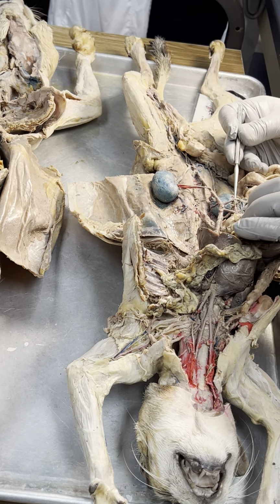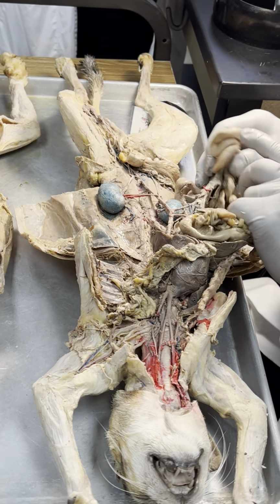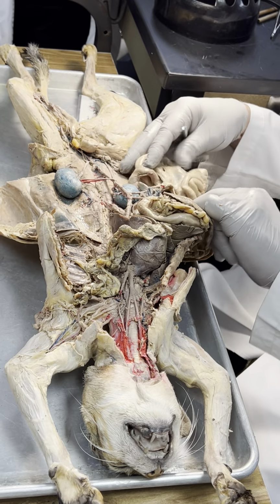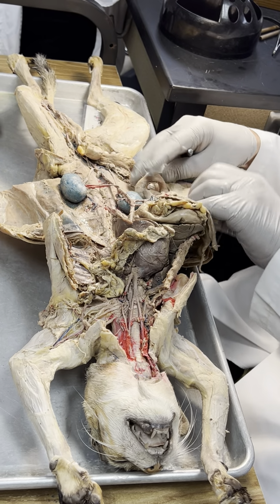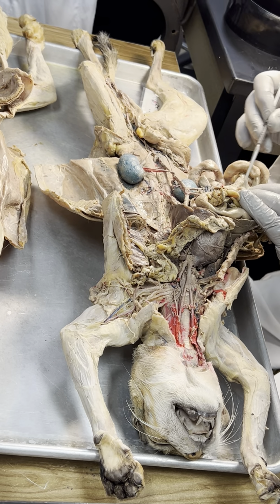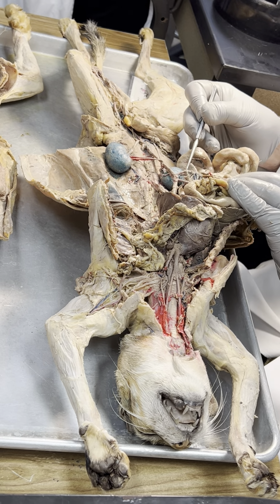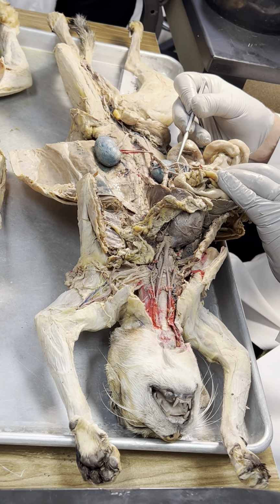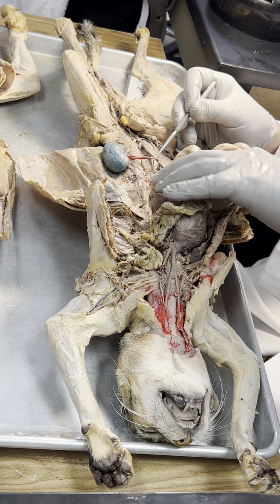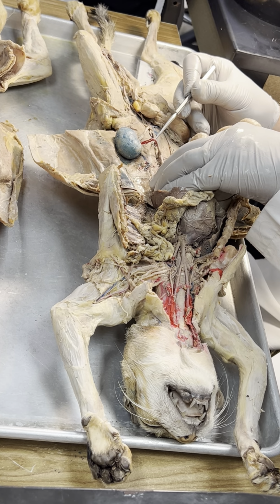And this is what? Superior mesenteric. Why? Because it's going to, yeah. And usually I'll do something like this, with this. And you'll see, where's that going to? Oh, it's going to this. And this is mesenteric, so that's superior mesenteric. Right renal, left renal.